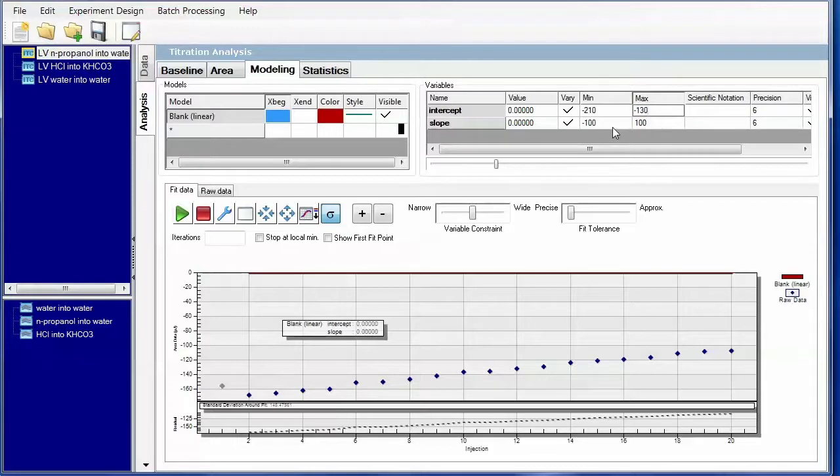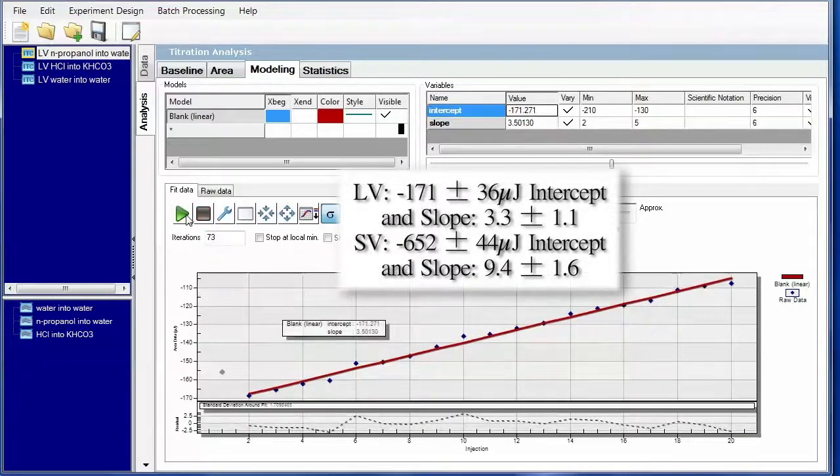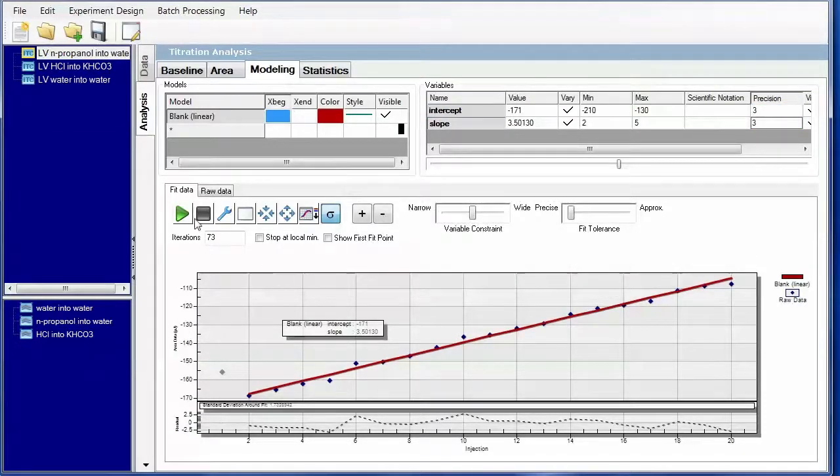And in the slope, we expect it to be anywhere between 3.3 plus or minus 1. So again, putting in some values here to do smart fitting, which will enable us to get a fit much more quickly. So the data's been fitted, and we probably would like to change the precision as we did with the water into water titration as well. Refit, and we're done with that.